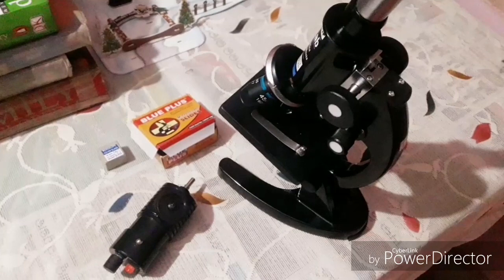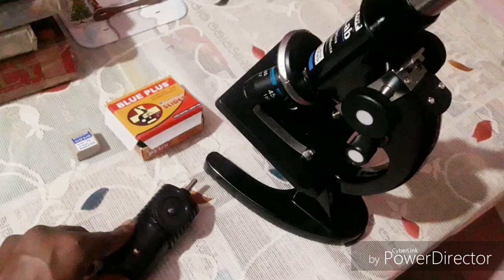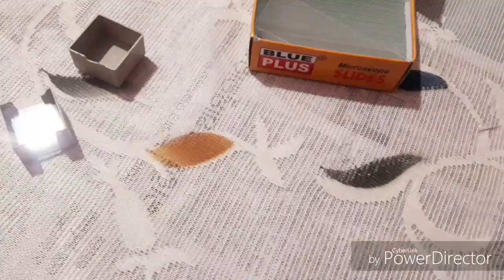These are all the equipments that will be needed for the experiment. Here I have my microscope ready, and as I'm working at night I'll be using my microscope LED. Then I have a stack of glass slides over here and a few cover slips.